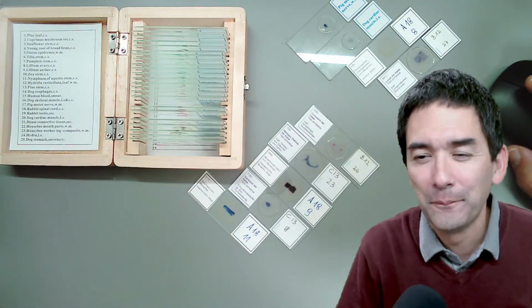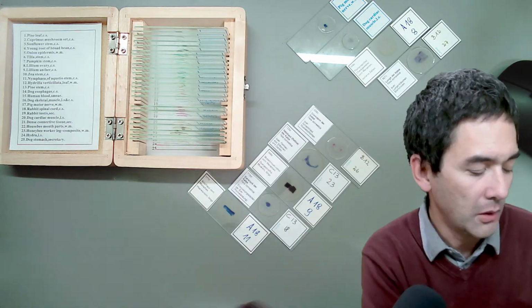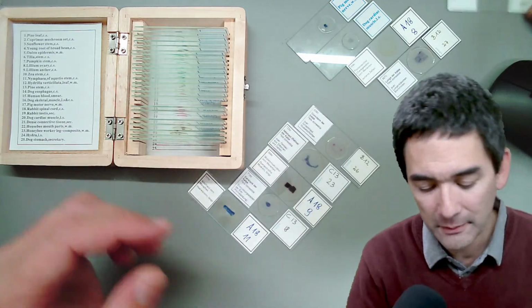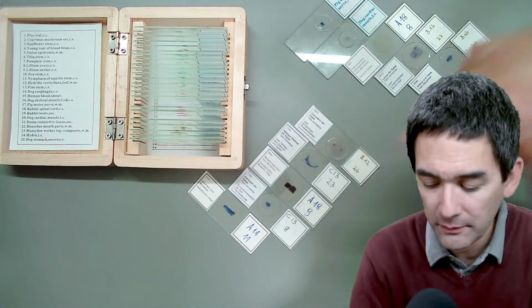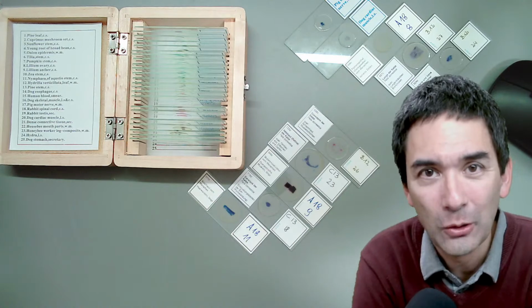Okay, so let's have a look again. This was basically the artery and vein. I just want to make one brief comment. I made a video recently, also on this very channel, a few days back, where I showed those slides to my six-year-old nephew and my sister-in-law.